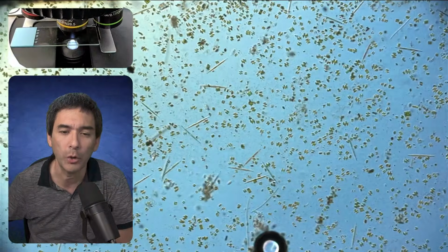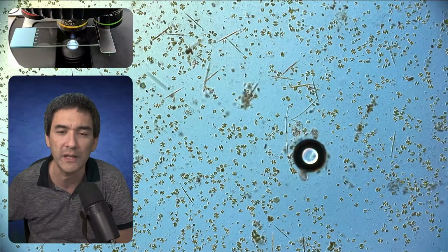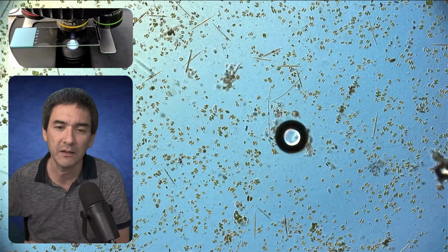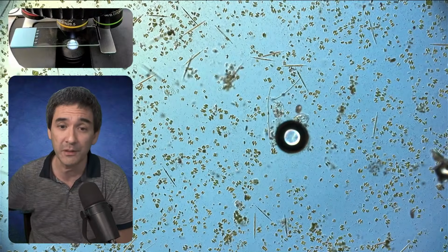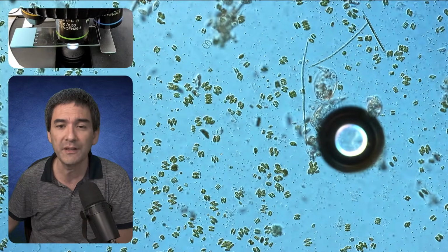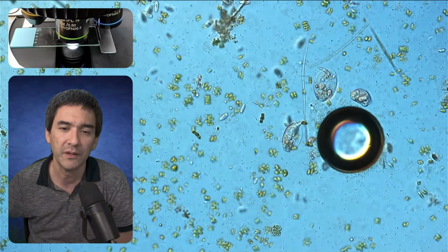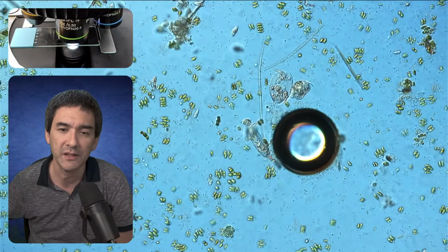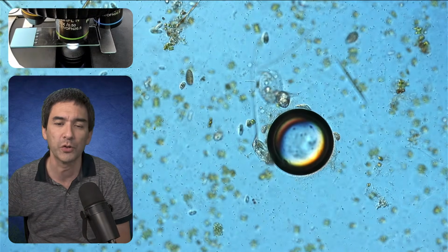So the recommendation is, if you don't see anything interesting right away, then wait a few days, because there is usually a progression of organisms, and over the next couple of days, different organisms will start to grow, others will disappear. And notice this air bubble over here. You see that those rotifers and some of the ciliates that are there, they will gather around those air bubbles, because they need oxygen. So that's something that you can observe quite often.